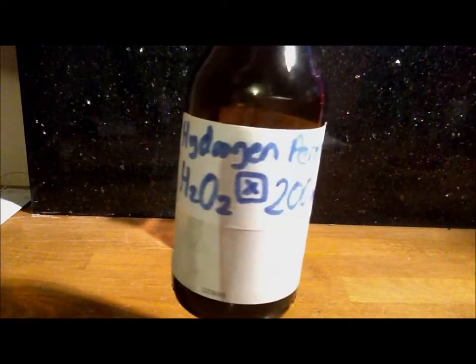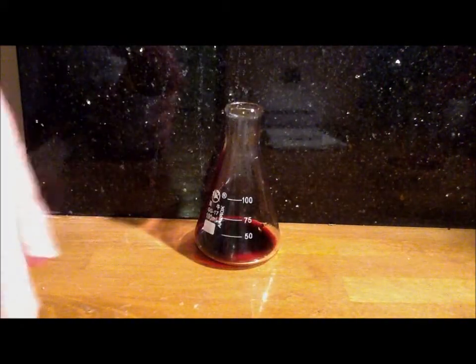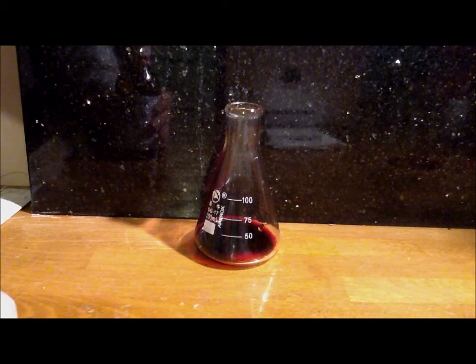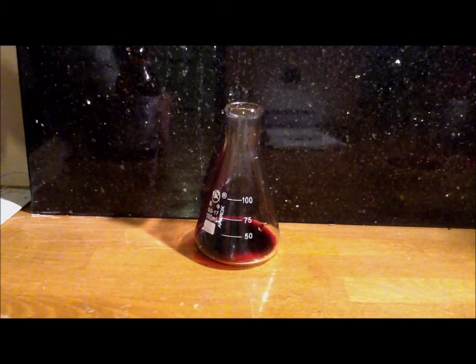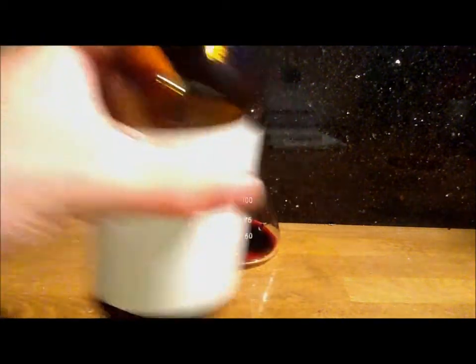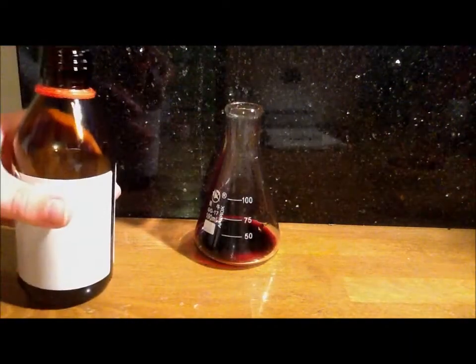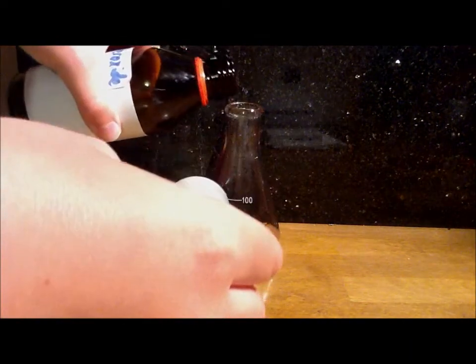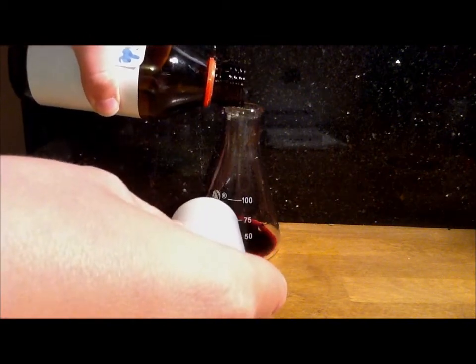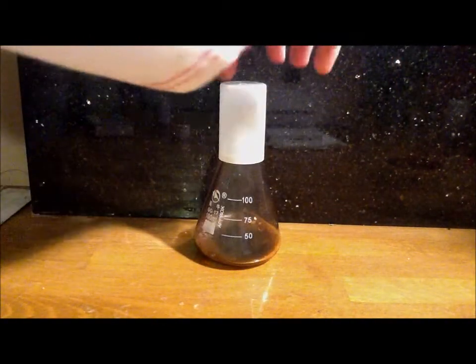And then, you want to get your hydrogen peroxide and get the hydrogen peroxide bottle in one hand and the plastic cap in the other hand. And then be very quick, you don't want to add too much because the reaction is very vigorous as you can see there.